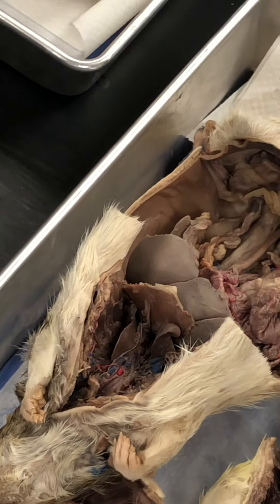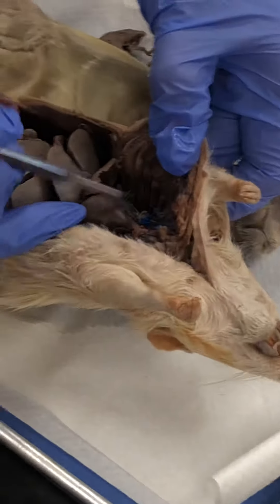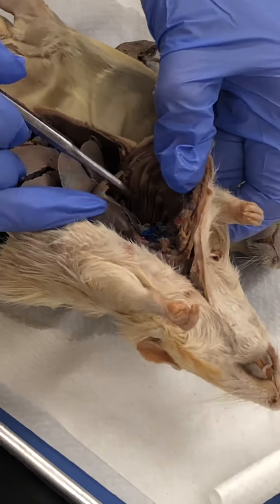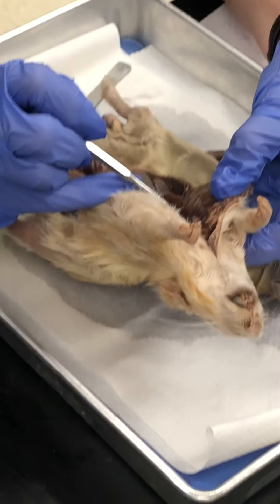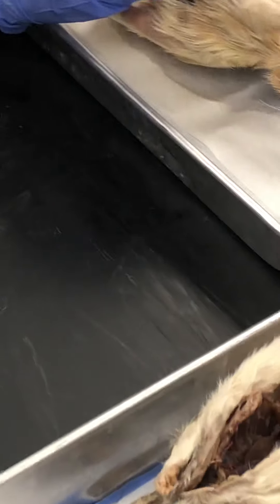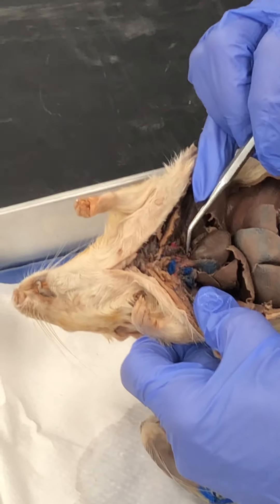Now we go to the heart. This is the right atrium, right ventricle, left atrium, left ventricle. Remember you're looking at the rat, so right and left are the reverse of yours. The arch over the top of the heart right there is the aortic arch.